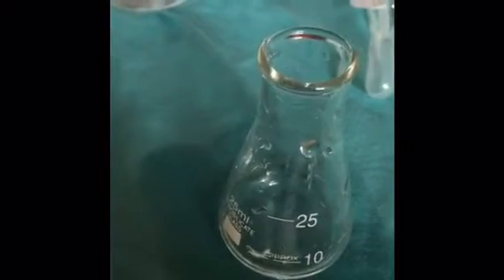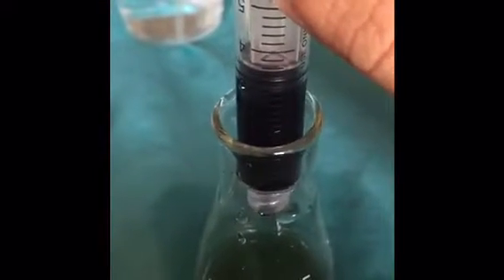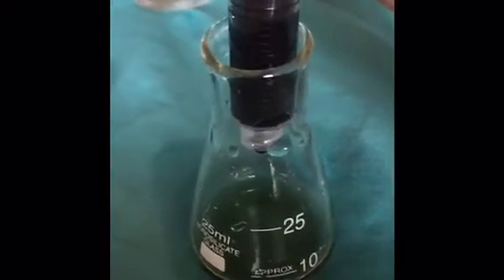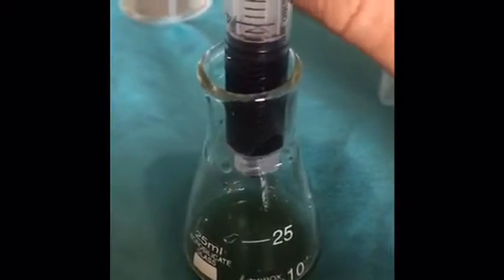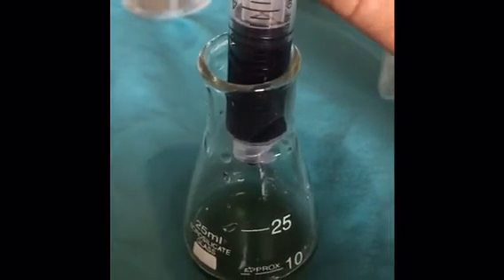So I will be doing this for 3 trials, and this is the first. Here is approximately 2.1 milliliters of the DCPIP solution that titrated my unknown in trial 1. I'm going to repeat the same procedure for 2 more trials to see if I can come up with an accurate prediction of the concentration.